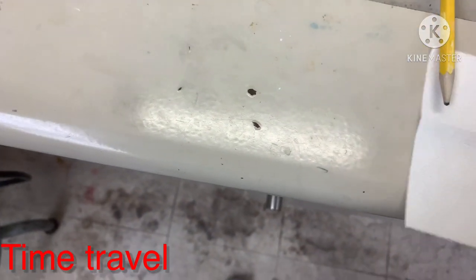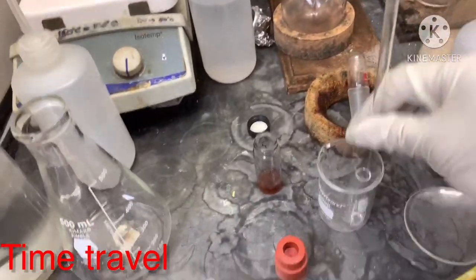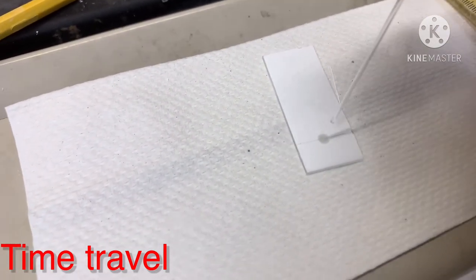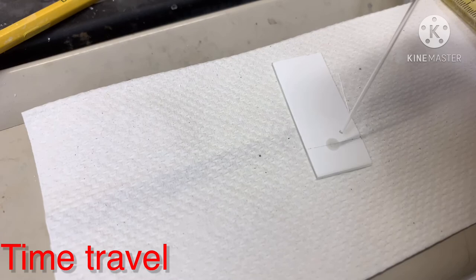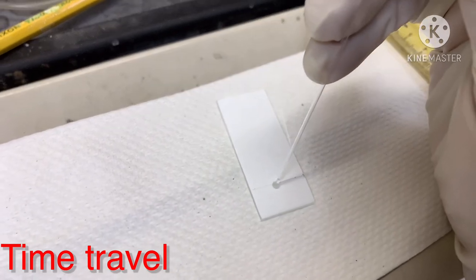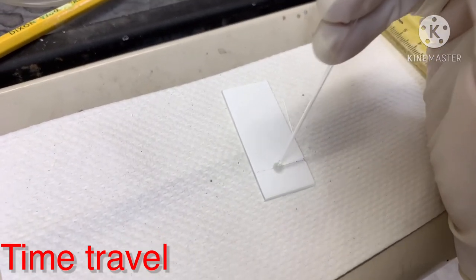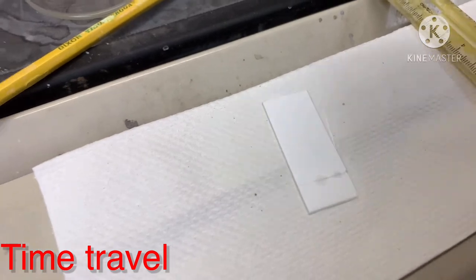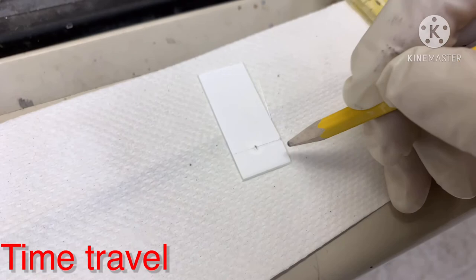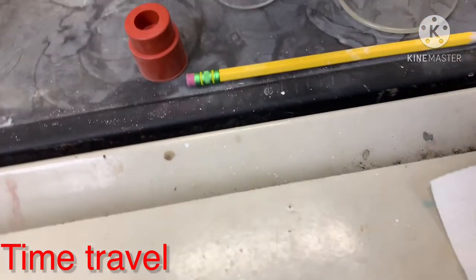From the crude solution, I make a spot on the baseline by lightly touching the plate and lifting quickly. For checking, I normally use two spots: one concentrated spot (touch a couple of times) and one diluted spot (touch once). You can also mark where you spotted the compound. Once spotting is done, we are ready to run the TLC.